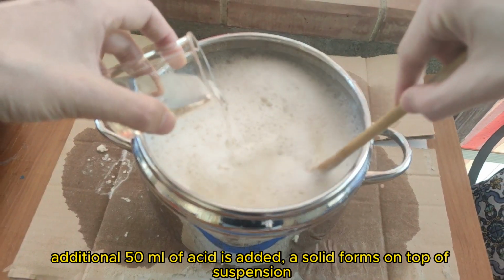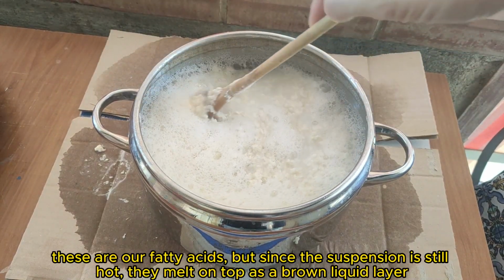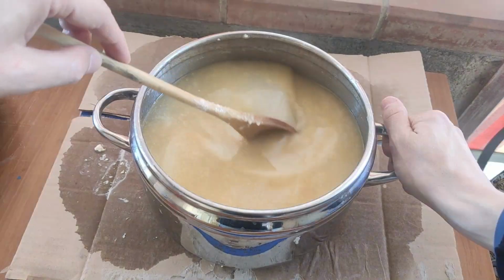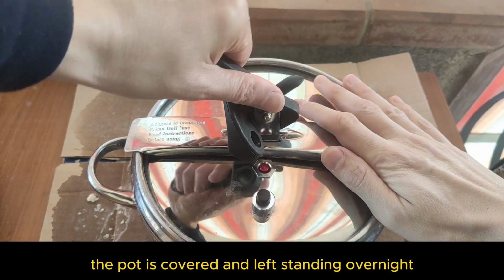An additional 50 milliliters of acid is added. A solid forms on top of the suspension. These are our fatty acids, but since the suspension is still hot, they melt on top as a brown liquid layer. pH is 5, so no more acid is needed. The pot is covered and left standing overnight.